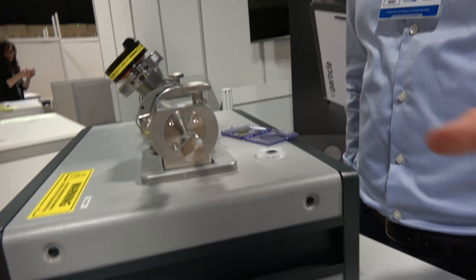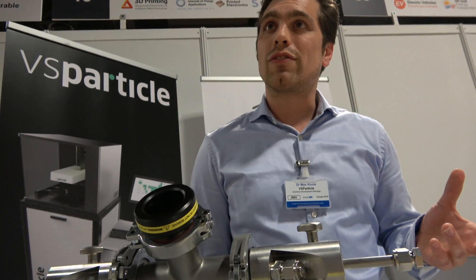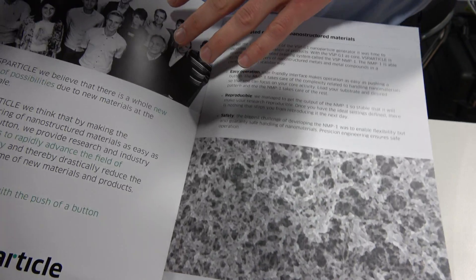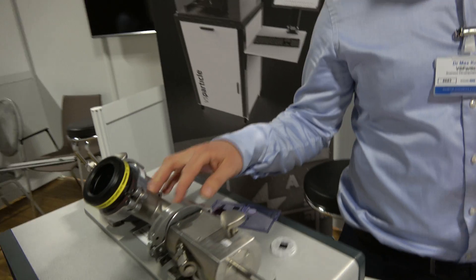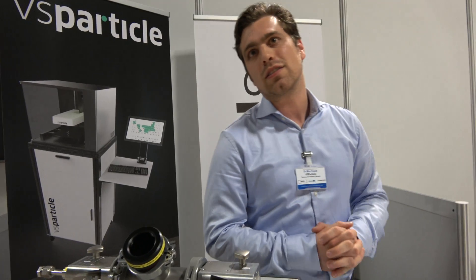So the next step: this gas comes out here and then we deposit it. We can spray it onto substrates and these nanoparticles will deposit on the substrates, and then you have a very, very pure layer. For example, this is a nanopore structure which we can print. And this is pure because we don't use any organic components. If you use gold electrodes, you have a gold nanostructure. If you have nickel electrodes, you have a nickel nanostructure. So the whole process is material agnostic — as long as the material is conductive and solid, we can turn it into nanoparticles, into a nanoaerosol, and deposit it on a substrate.